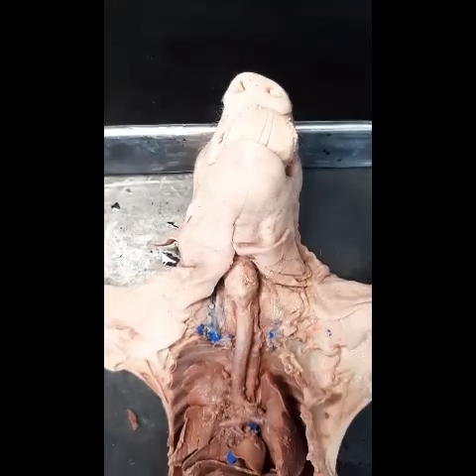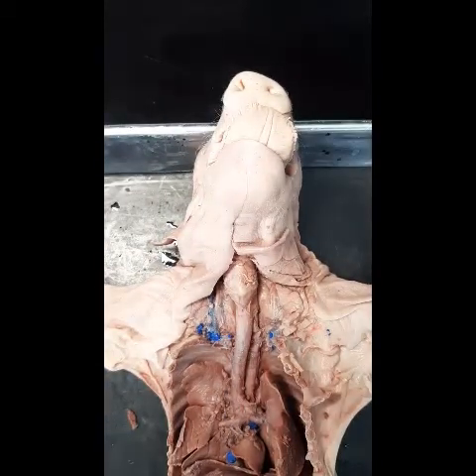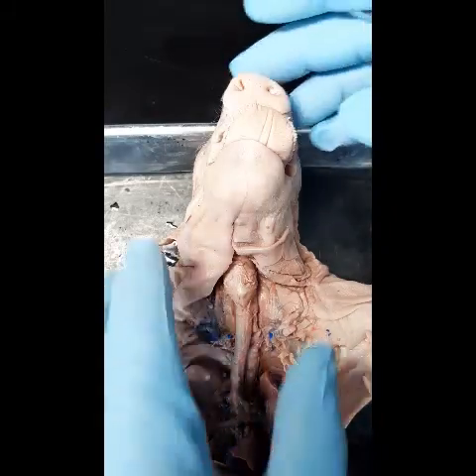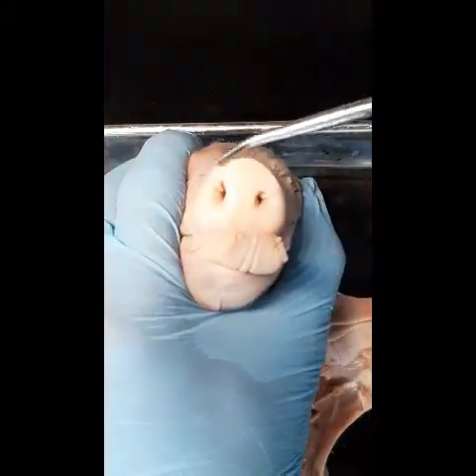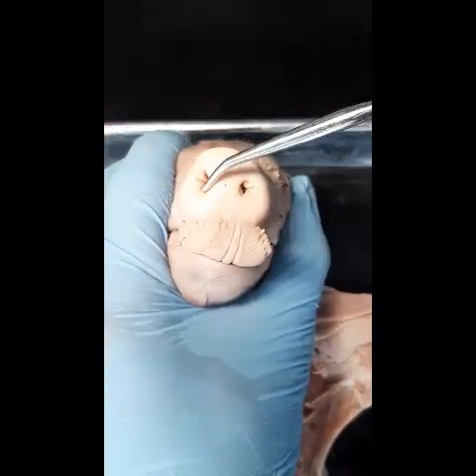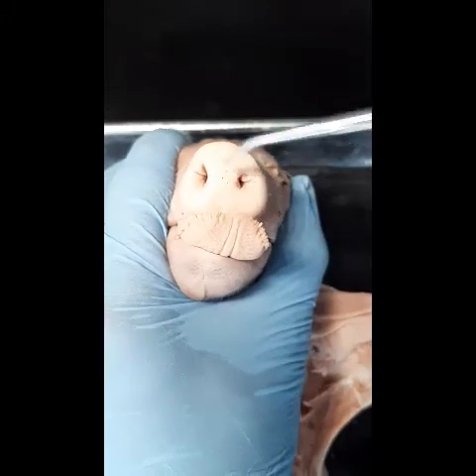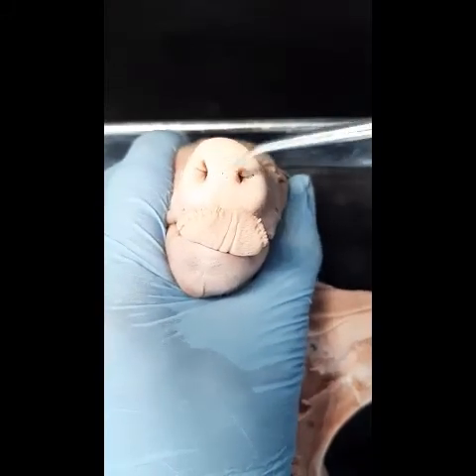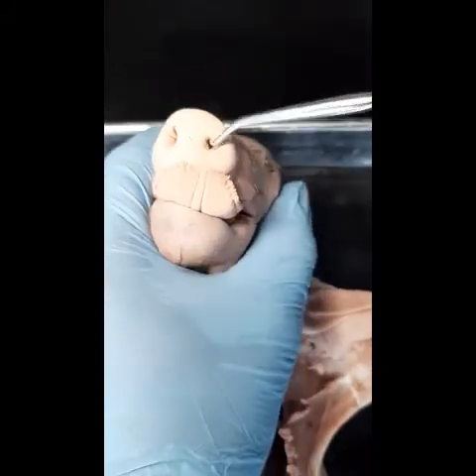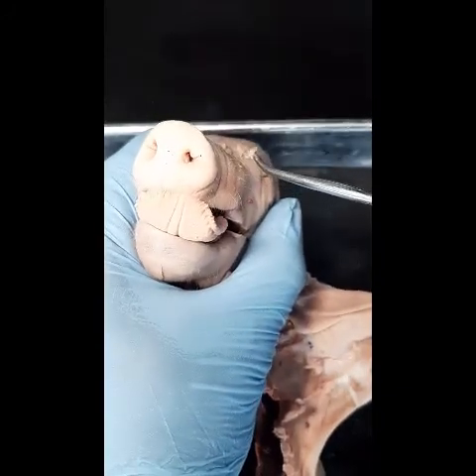This is Dr. Alcindor and we are looking at the respiratory system of the fetal pig. Let's begin with the nose or the snout. We have the nares or the nostrils — external nares or nostrils — which lead into the nasal cavity.